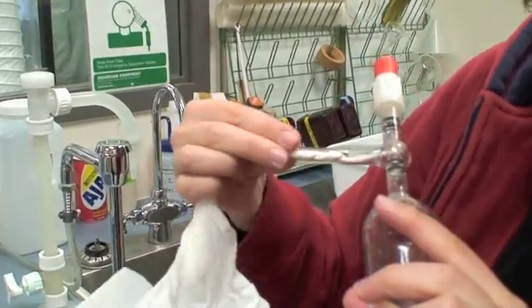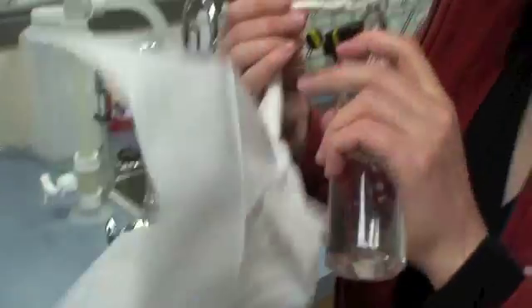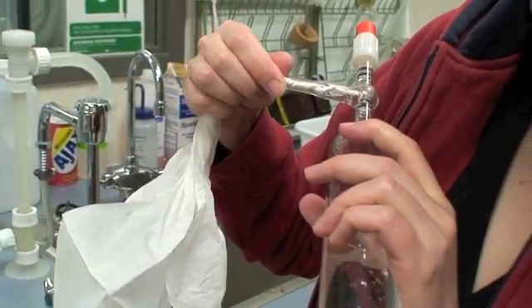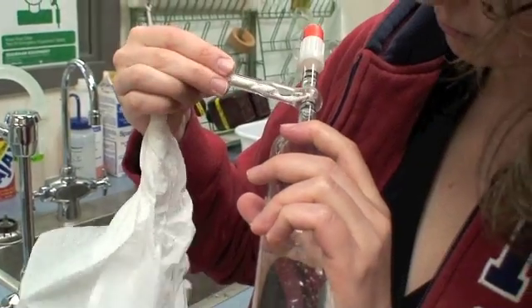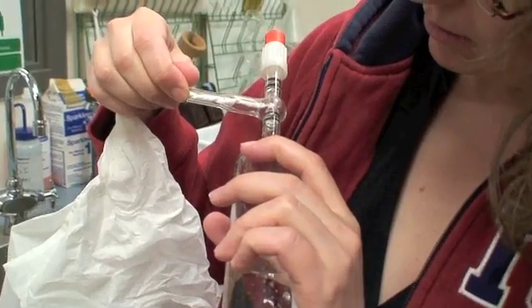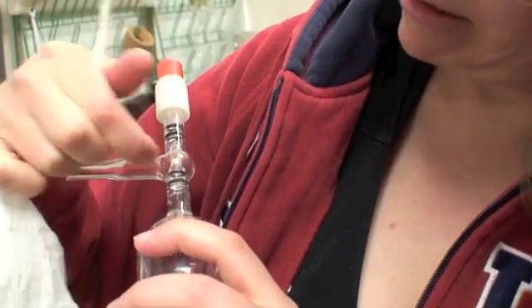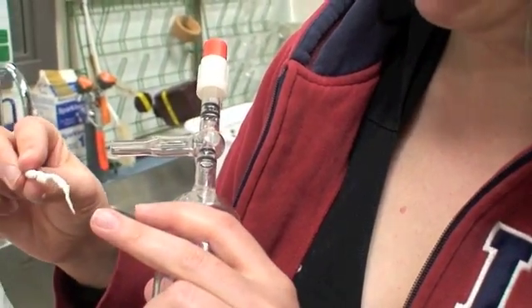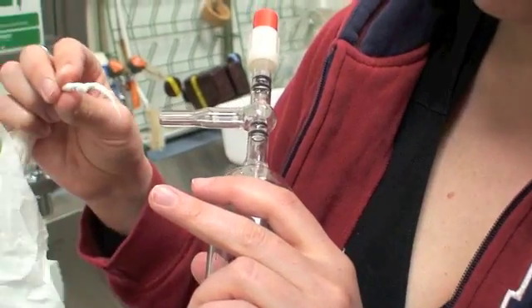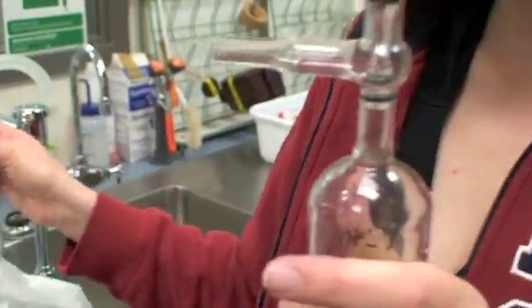So get as much as you can, but don't go insane. Particularly if you can get any water that's going to be in the space out. And sometimes if you just get the little tip of that into the water droplet, capillary action will pull it all out. Okay, so that's pretty good.